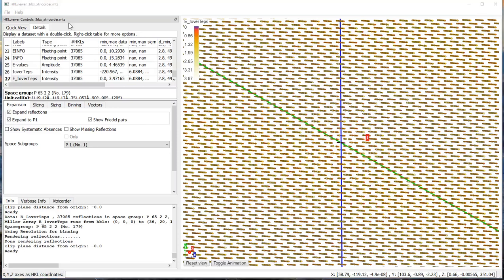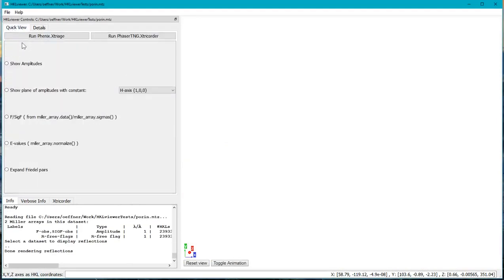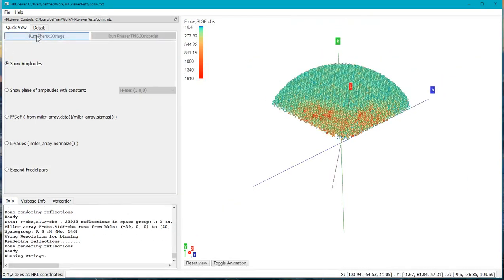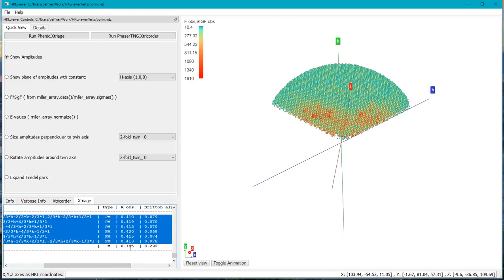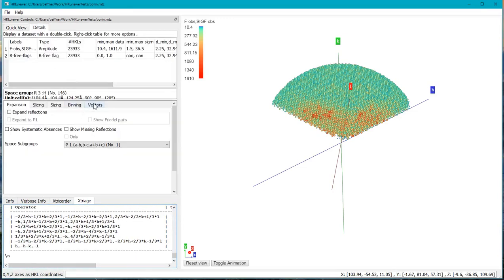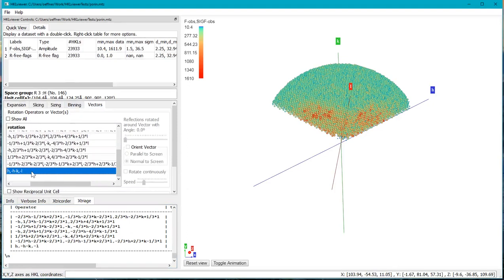Now let's show how to inspect the twin law. So let's load the Phenix tutorial dataset called Porin, which has got some twinning. We go back to the Quick View tab here, show the amplitudes data, and then we run Phenix Xtriage. And Xtriage tells us that there are these possible twin operators here, and the one with the lowest R factor, which is the last one, is the one that we're interested in. And we can go here on the Details tab and find the Vector tab and see that this is actually that twin operator here.